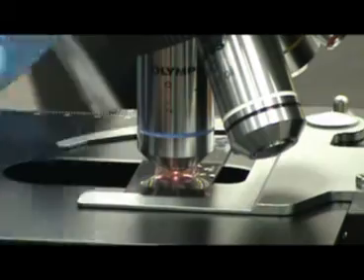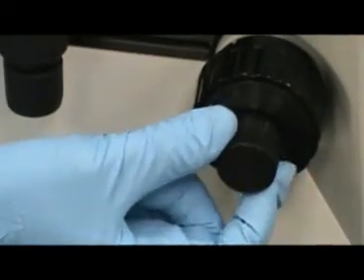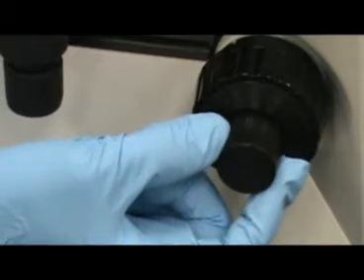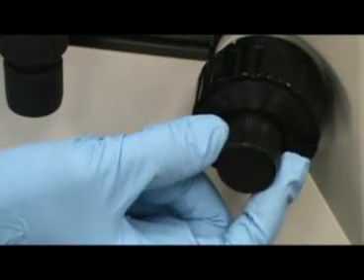Now you will switch to the 40x objective. Again, you should focus with the fine focus knob. This image is the same slide being observed with the 40x objective. This has a total magnification now of 400x.